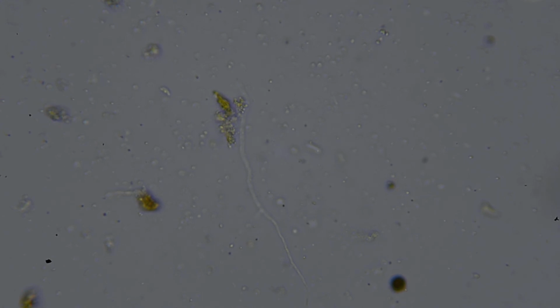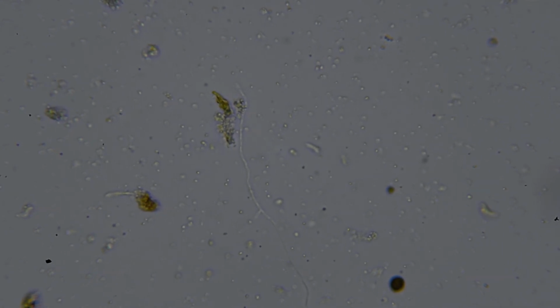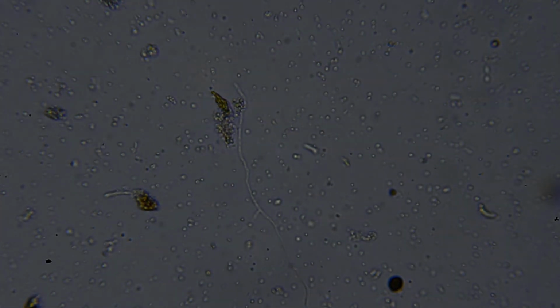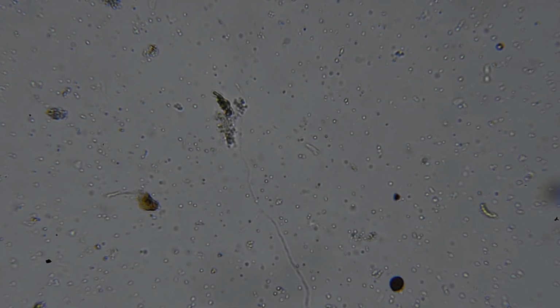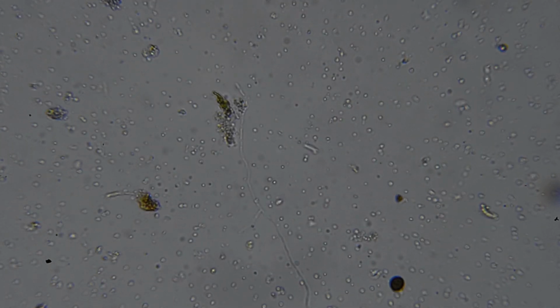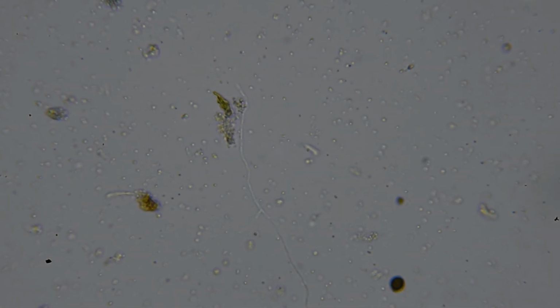And I think I do some shadowing here at one point to give you a better view of all the bacteria. So yeah, I'm trying not to talk about their function because I'll talk about that more when we have an actual meeting. Yeah, the camera's not doing very well when it comes to lowering the amount of light that comes through the iris.